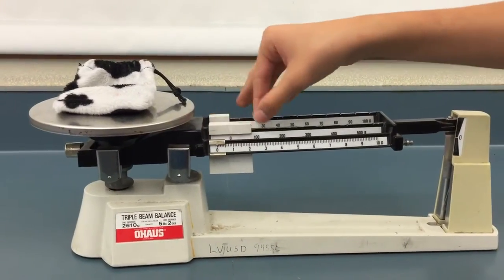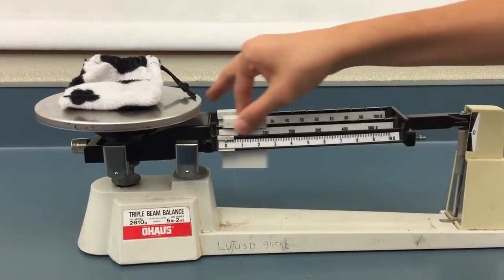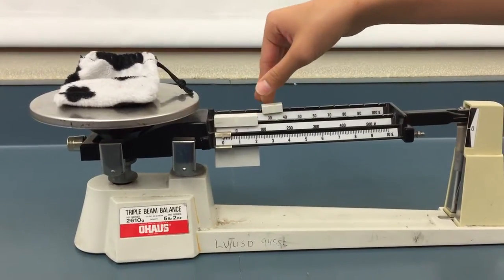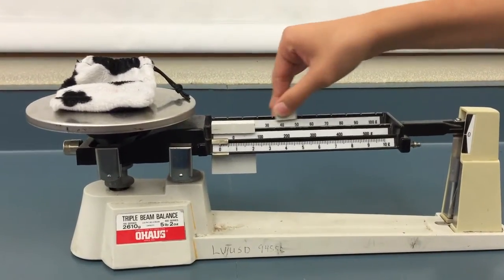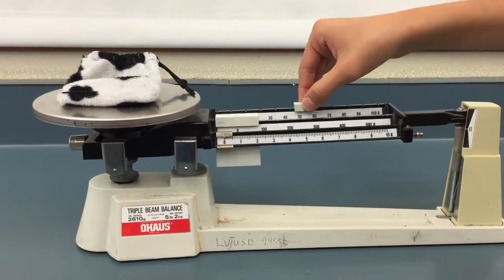So this one's pretty heavy. Just kind of sinks down. So I'm going to start with the 10 gram. Start at 30, and it still isn't enough. So 60, maybe 50.